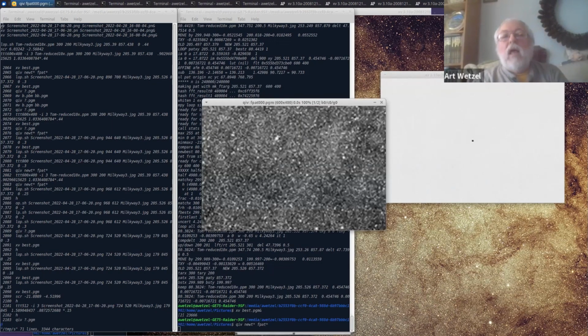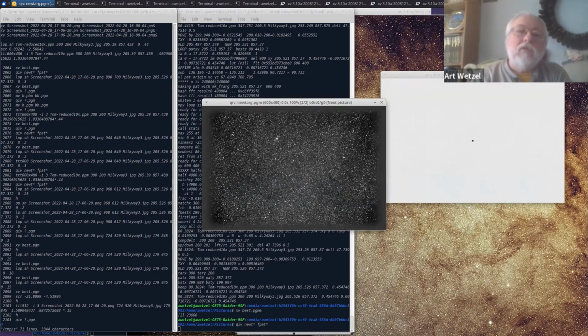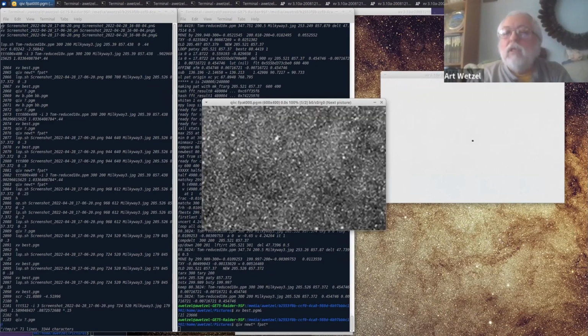And here is the alignment between these 2 images. Now, you see there's a little bit of residual there. And that residual is in large part because Tom was really zoomed in here. And of course, the telescope had a pretty flat field of view, did not suffer from barrel distortion like wide angle lenses do, or especially with zoom lenses, you'll sometimes get pincushion distortion.